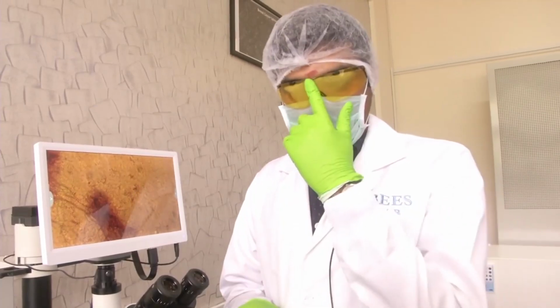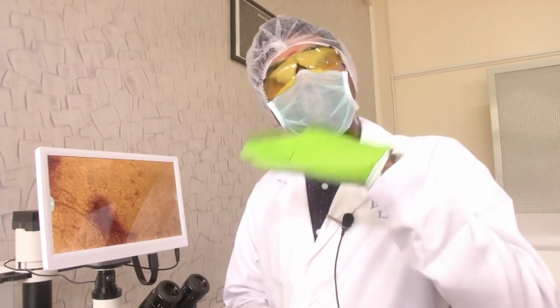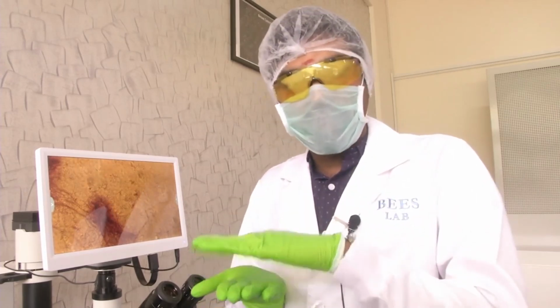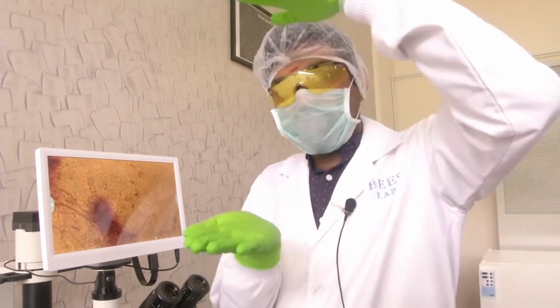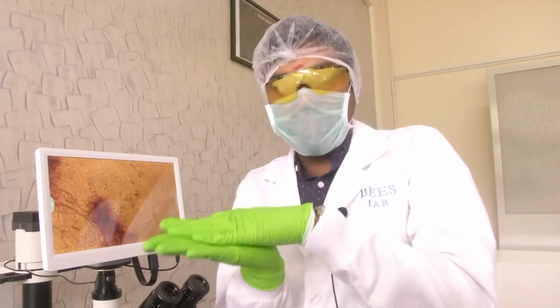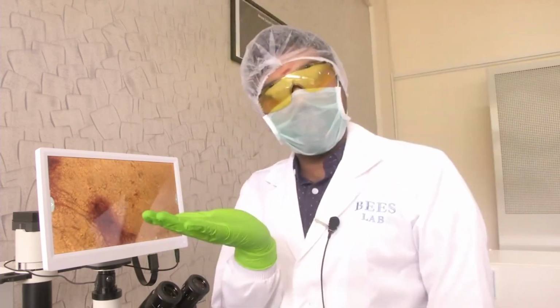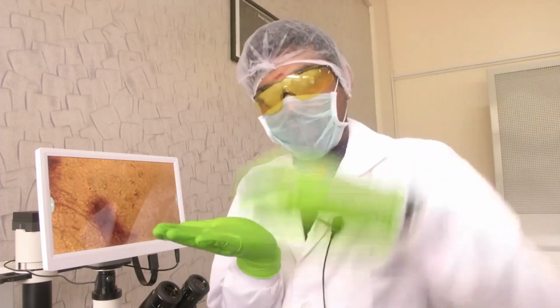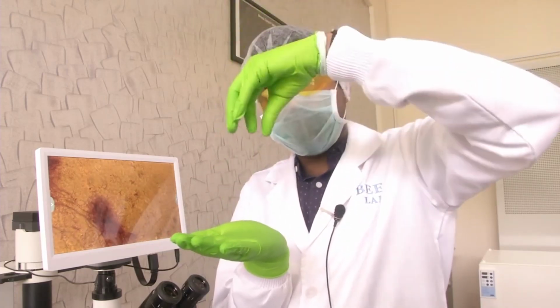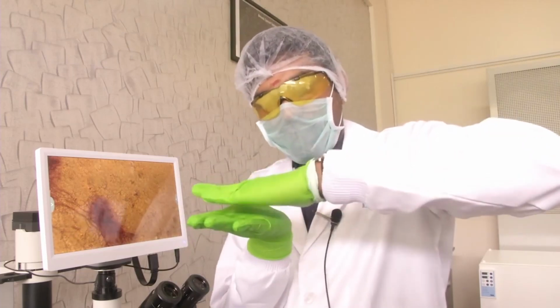If we have the objective at the top, it will have to focus, and it might end up focusing on the surface of the liquid, and it might not go to the cell that is attached at the bottom, because there are layers of liquid or content before it reaches the cells. So I hope it is clear. The objective is on top, light can either be from bottom or from top. If we are capturing light from the top, the objective has to focus at multiple planes, and we will not be sure whether it is actually focusing on the cell layer or any layer above it.